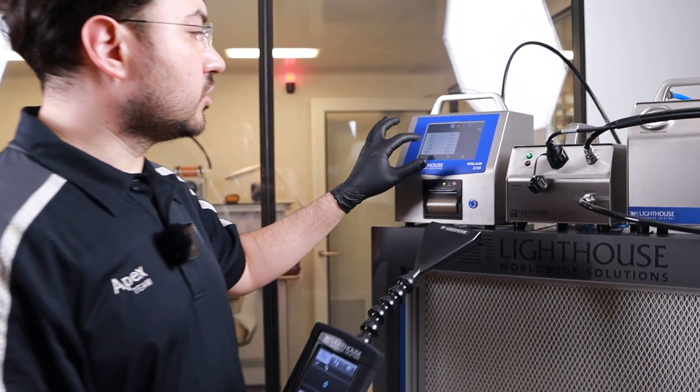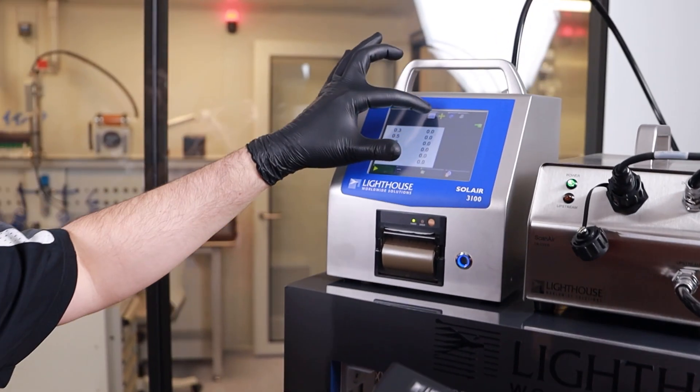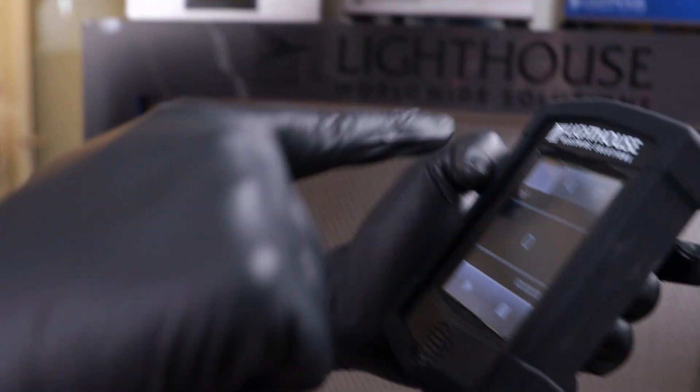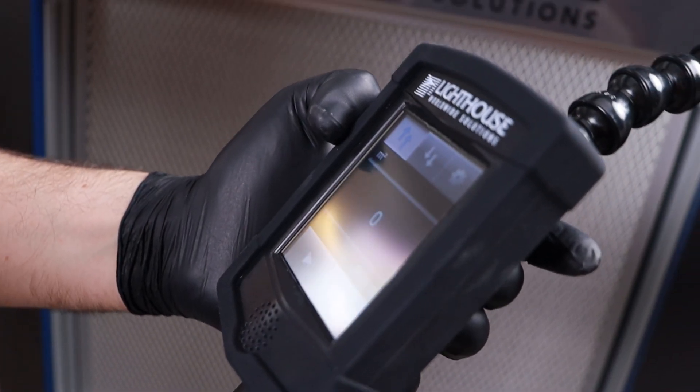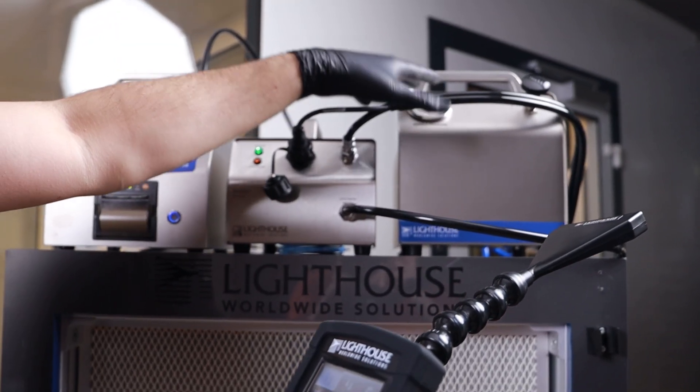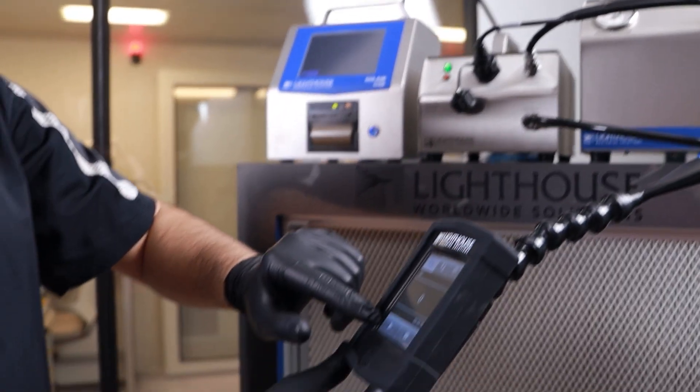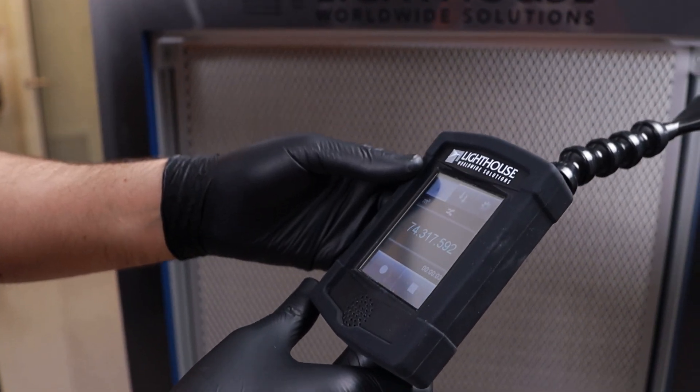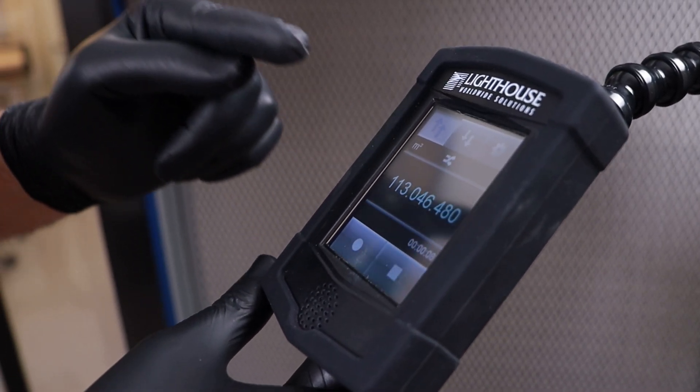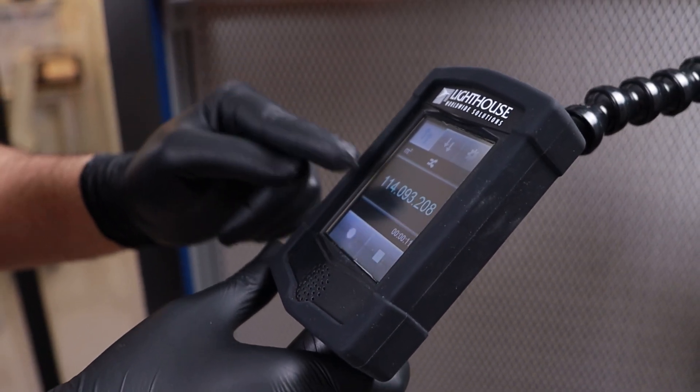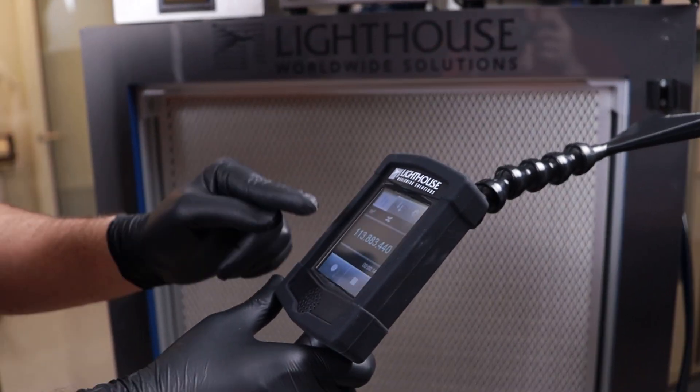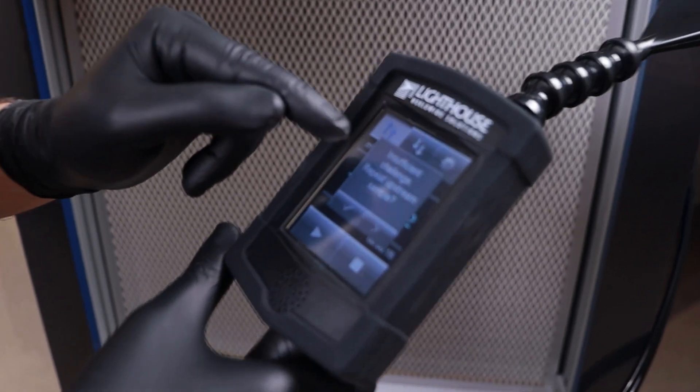So the system, when we turn it on, we have to move into scan mode first. Now we have this upstream scanning menu. This upstream scanning menu allows us to collect all the particles that are generated by our aerosol generator. Now I am scanning it and trying to understand that if the aerosol is enough or not.